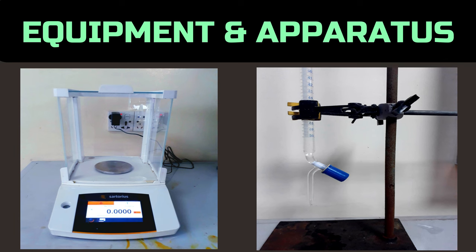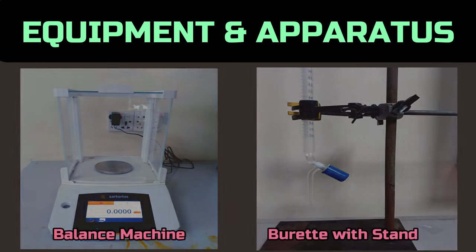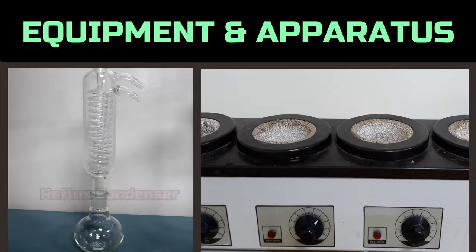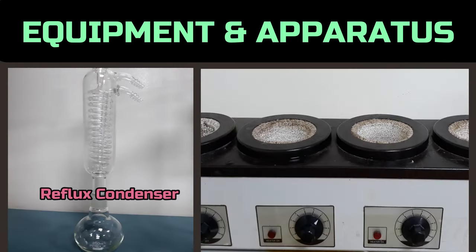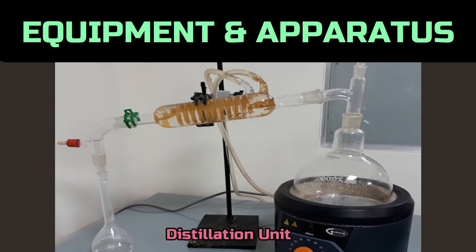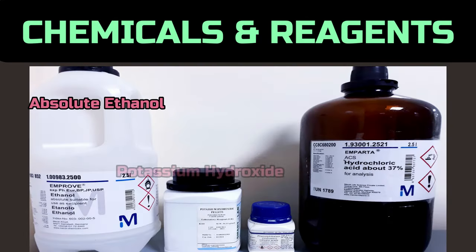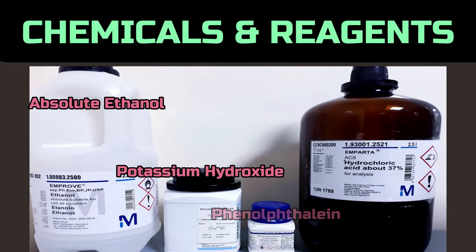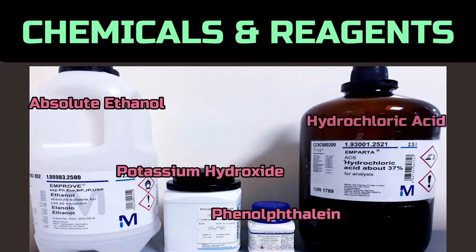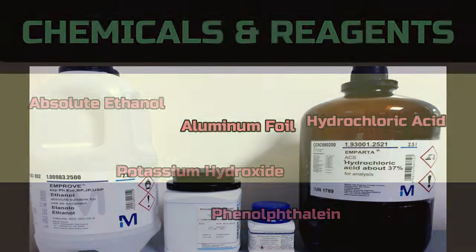To carry out the whole test, we need a balance, burette with stand, reflux condenser, heating mantle, distillation unit, absolute ethanol, potassium hydroxide, phenolphthalein, hydrochloric acid, and aluminum foil.